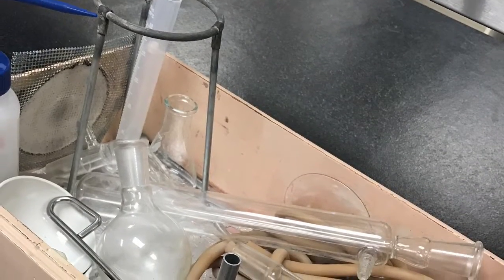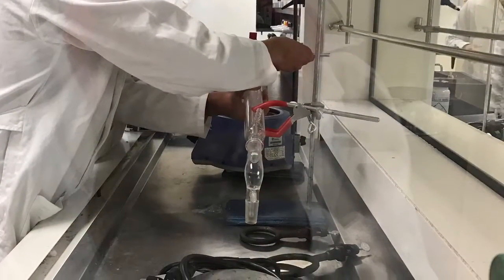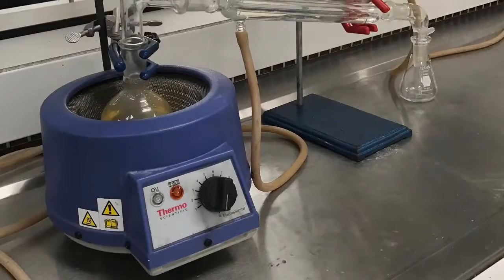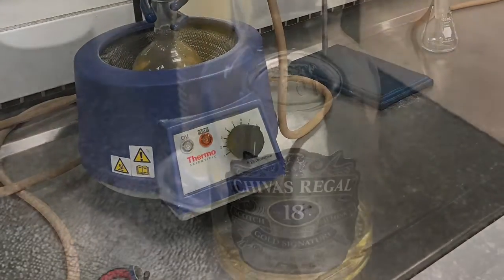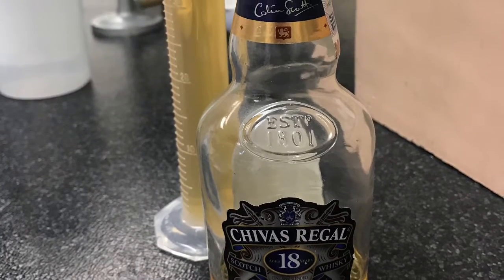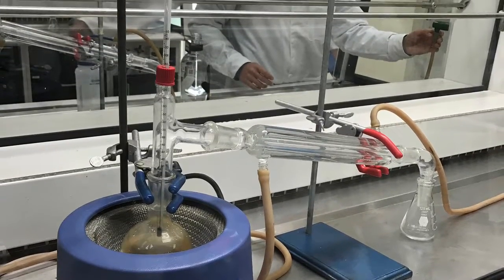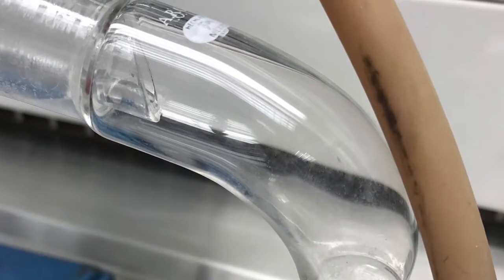Distillation is a process and a method of separating the components of a liquid substance. It's very interesting that to get the different components of the mixture, we have to take care of the temperature. This method passes through evaporation and condensation, and in the practice we had to take care of the temperature between 60 and 80 degrees.